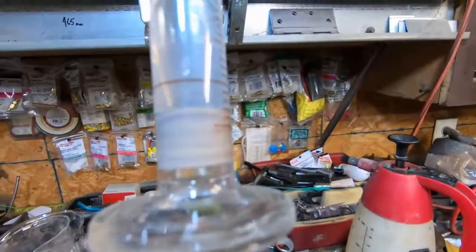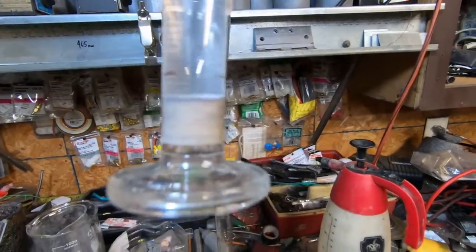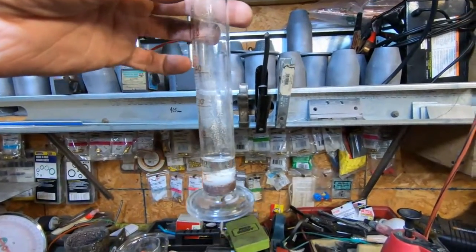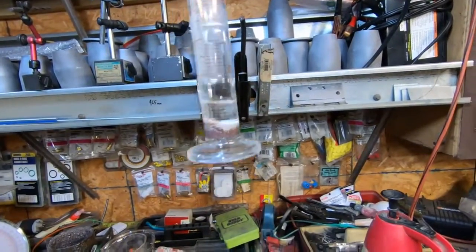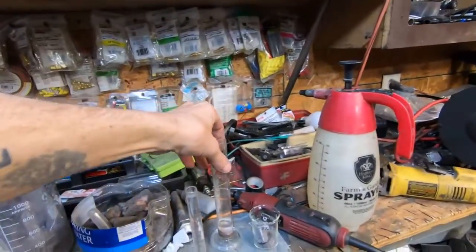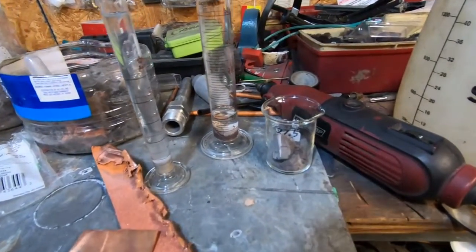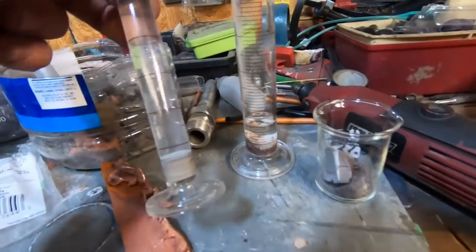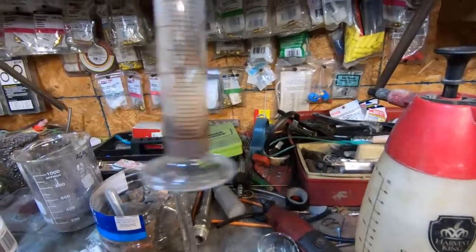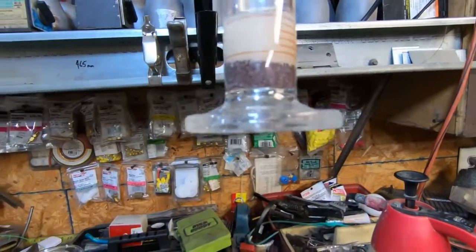I am able to isolate this gray material. We have two different gray materials now — a dark gray and a light gray. The way I've isolated this is kind of like a sedimentation mass chromatography. I shake the beaker up real fast and the heavy stuff settles right away, but a suspension of the other liquid remains. I simply immediately decant that into a smaller graduated cylinder, and I've been very successful at getting nothing but this material out of the beaker by doing exactly that. Then I hurry up and dump that top solution out.